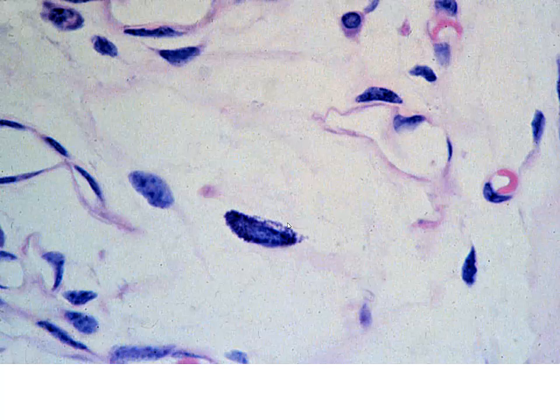Once again, very high magnification. This is really cool, looking at our capillary, a single endothelial cell. So I guess you could honestly classify this as a simple squamous epithelium. That's going to be kind of hard to do since it's one cell, but you can see that one red blood cell is barely squeezing through that luminal diameter. There we have another one out of the plane of section.